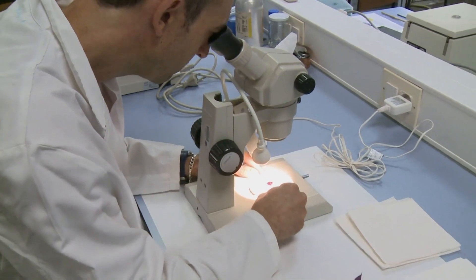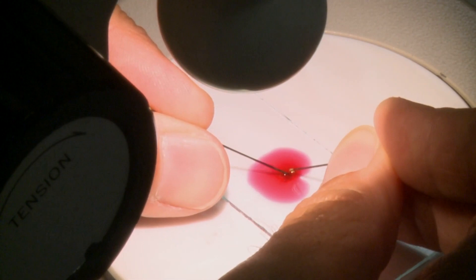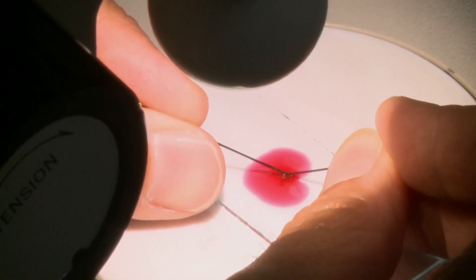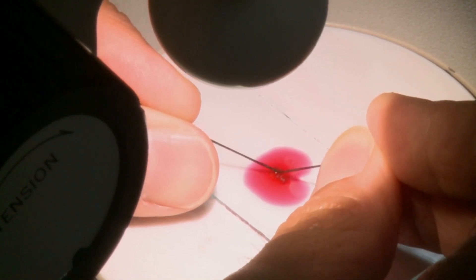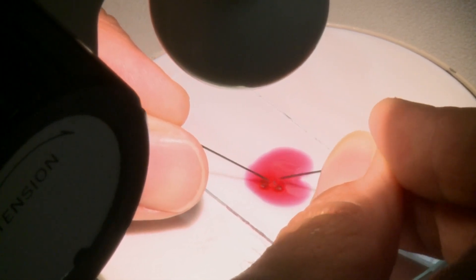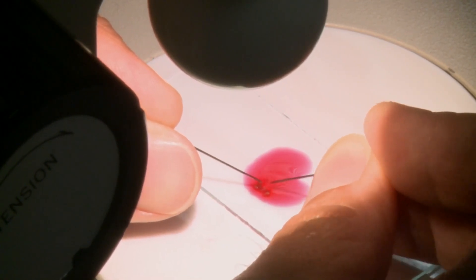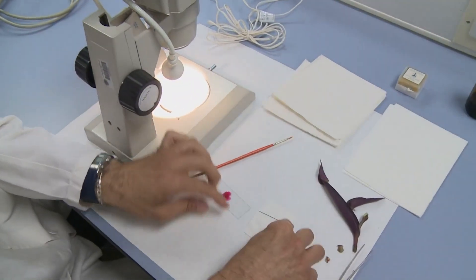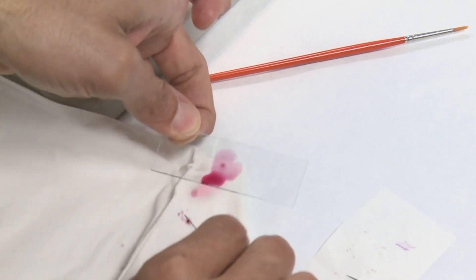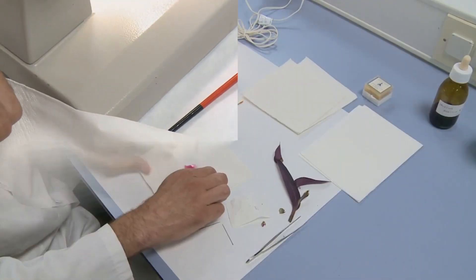We use a lens to focus the preparation, and with the help of the needles we have to open the anthers to let the cells that are inside go out, because we want to observe the cells that are inside, not the cells on the outside. So we break down the anthers and take out the covers because we want to see the cells that came out from the preparation. Then we have to clean the preparation a little bit, and with the help of the needles we take out the debris and let only the cells remain, and then we wait a little bit for the preparation to stain.